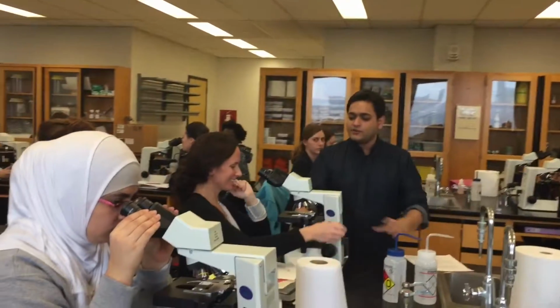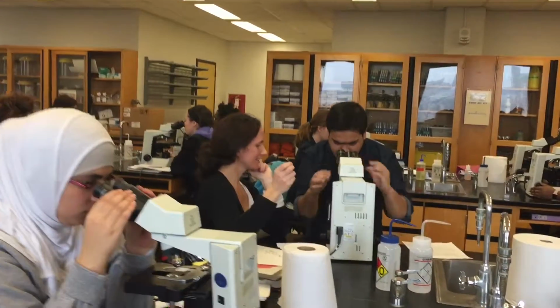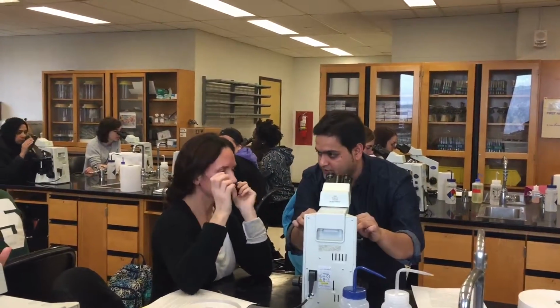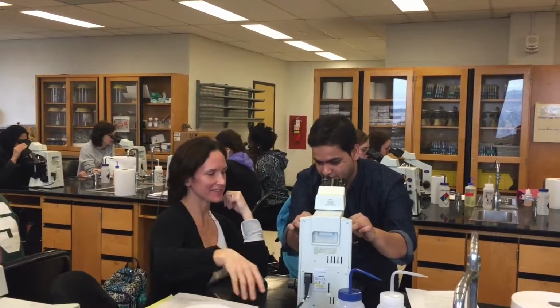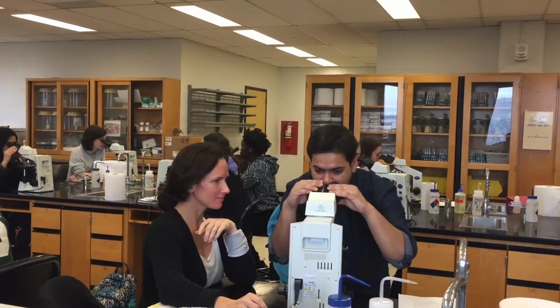Yes, no worries. So what you do is kind of keep your eyes there. I keep my eyes there, and make sure this one is sitting properly. I mean to say, it should be like this, you know. It shouldn't be like here. It should be like this. Once it is there, what I do is kind of keep my eyes there.